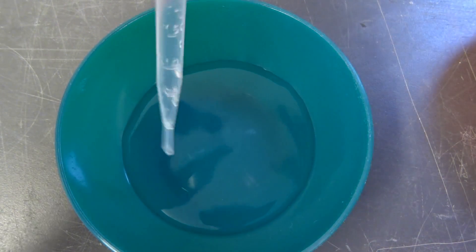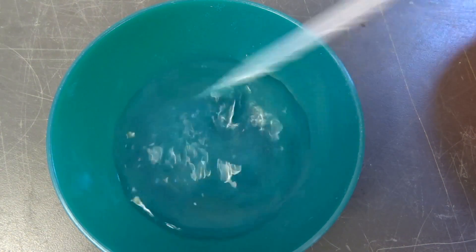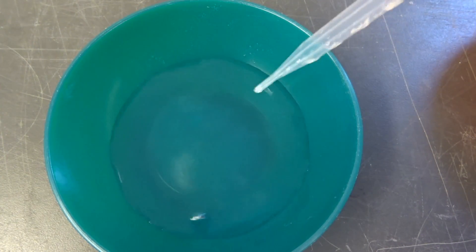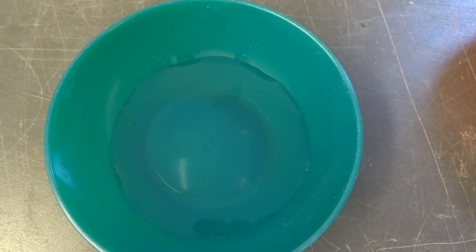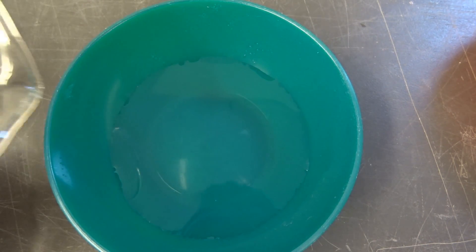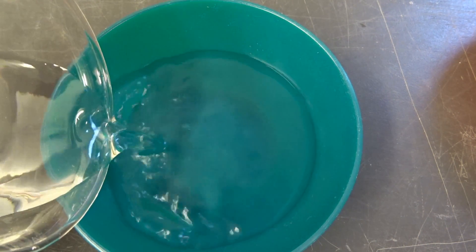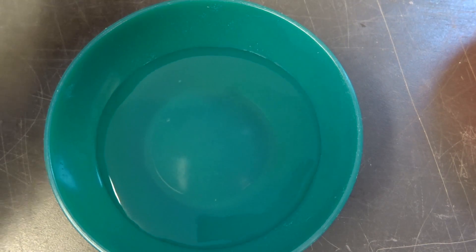So I use less water here, as you can see, and I'm also using less acid. So I'm just using more concentrated acid with less water in it, because these gels really just form in the water that surrounded them.